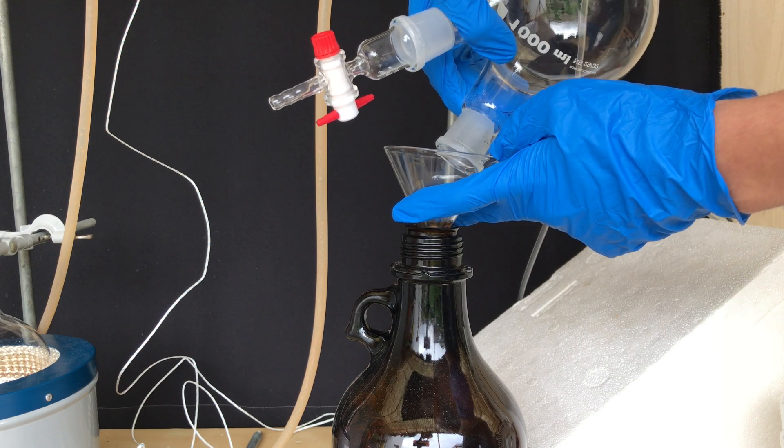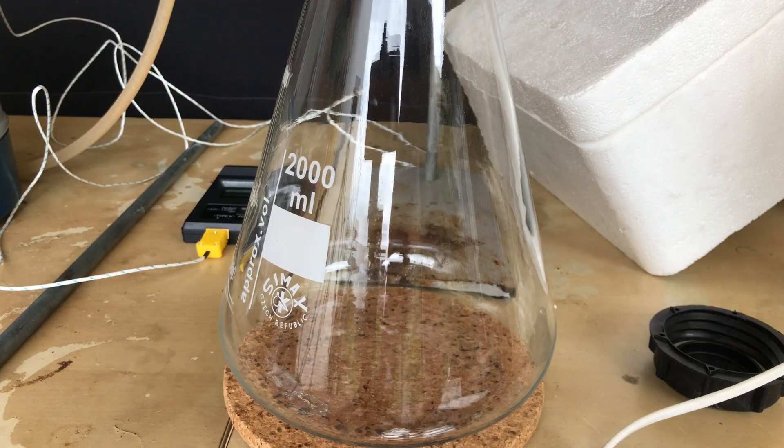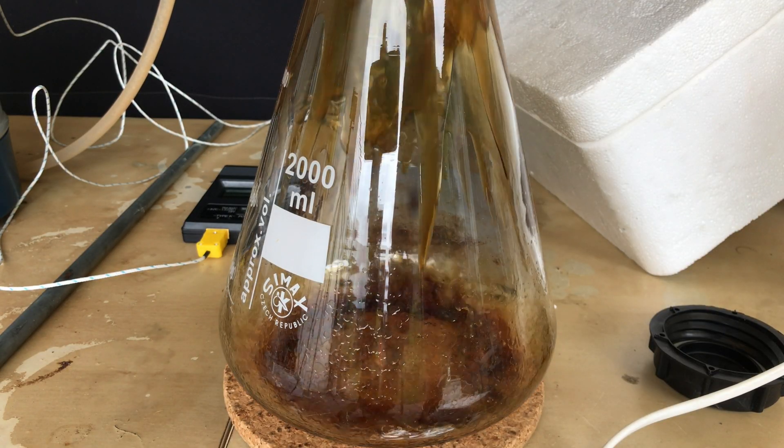It's not too bad, but it's also not going to be good for your health. The brown leftovers were transferred to another flask.